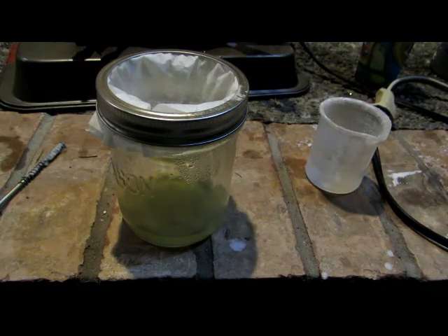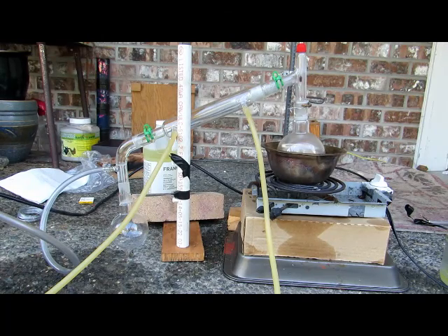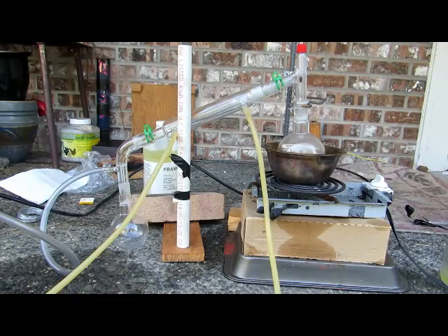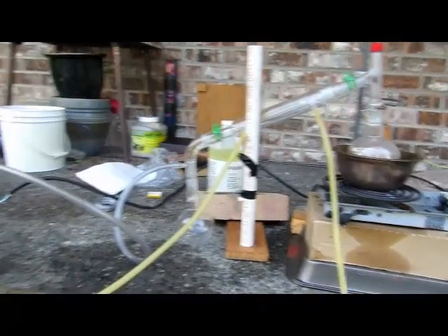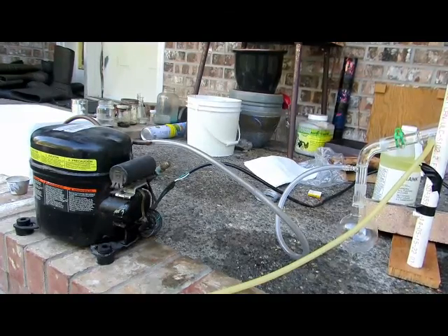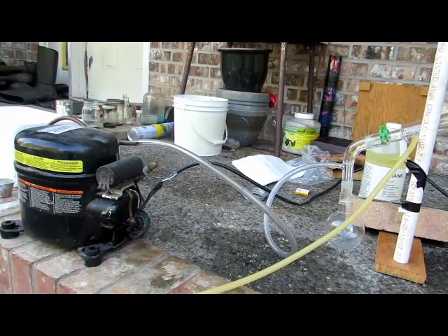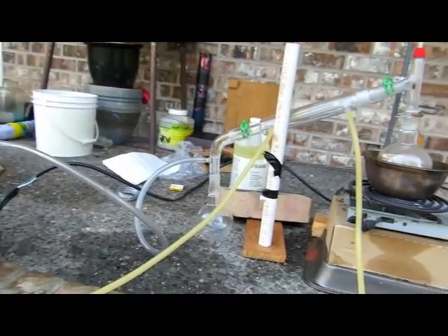It's the next morning. I put the product on a coffee filter and let it out on paper towel to dry — the paper towel absorbed most of the water. It's still rather wet but that's okay. Don't dry it in the oven because that will start to decompose your product. We want to decompose it in a vacuum setup, because it decomposes into hydrogen peroxide and water, and that must be done under vacuum since hydrogen peroxide can be explosive at higher temperatures when concentrated.